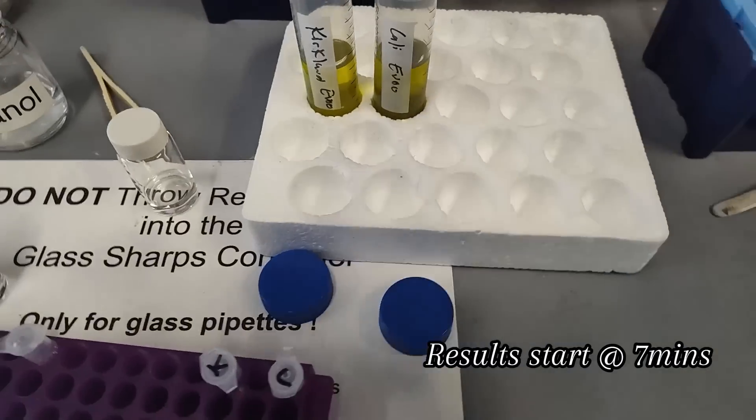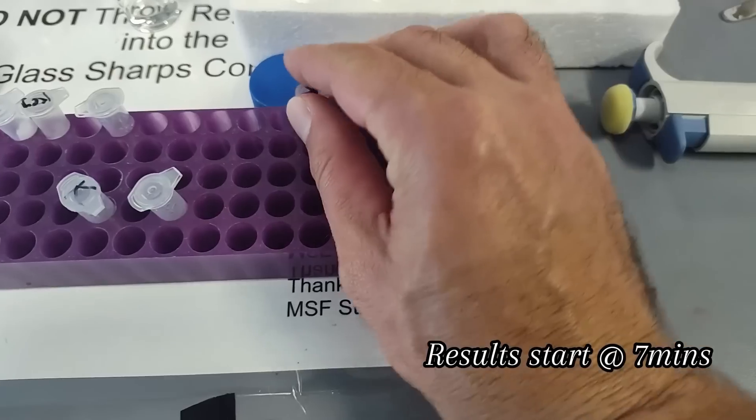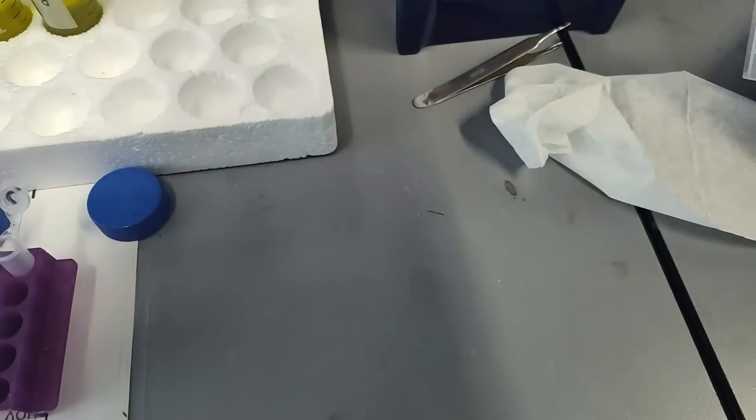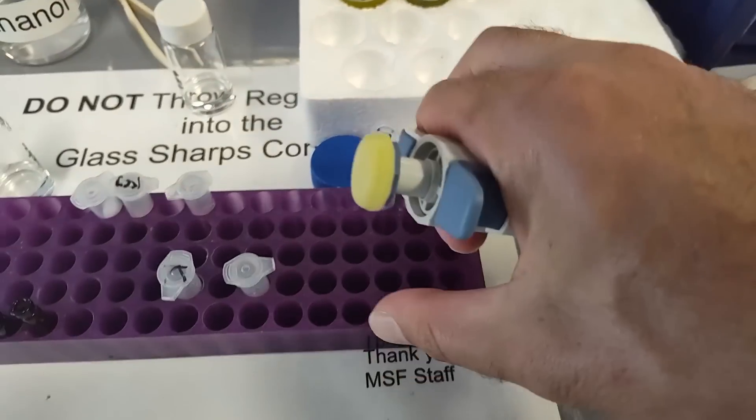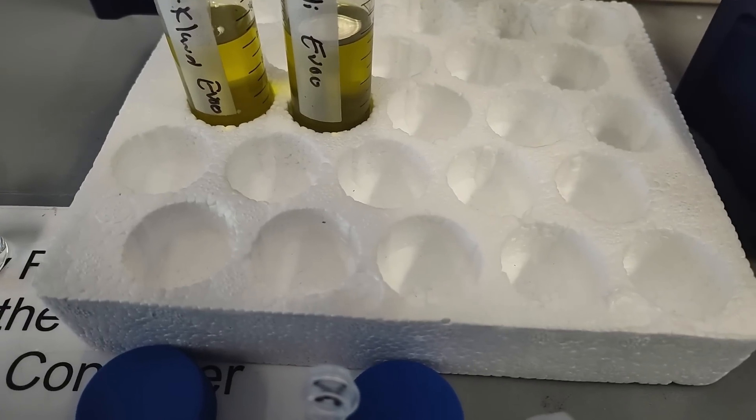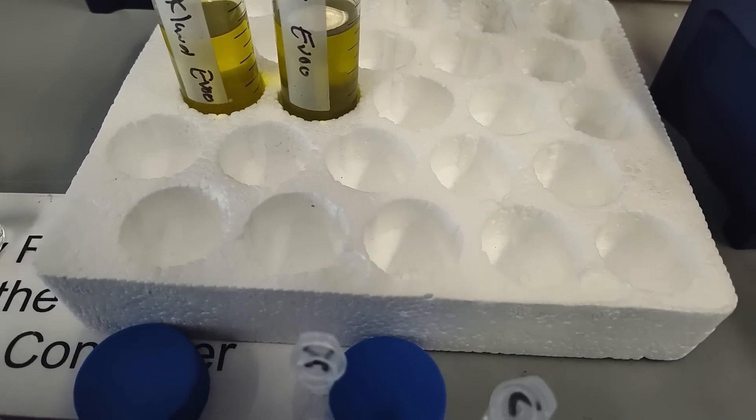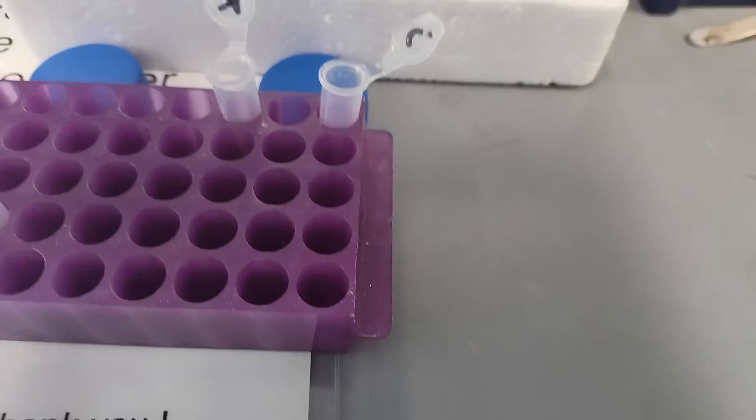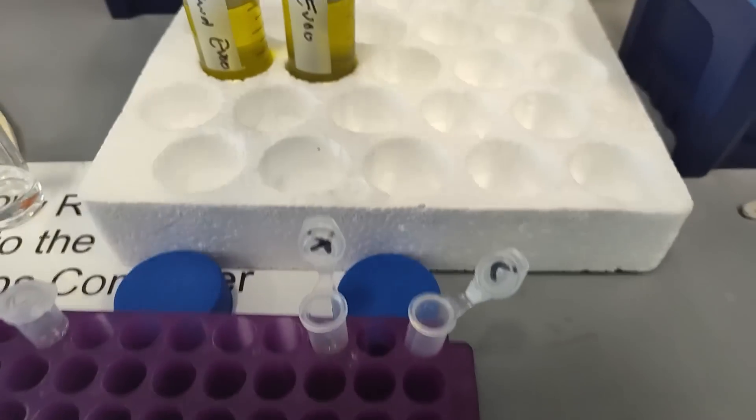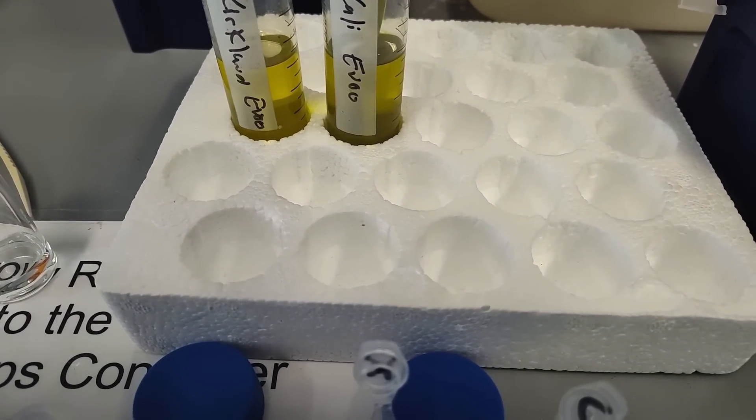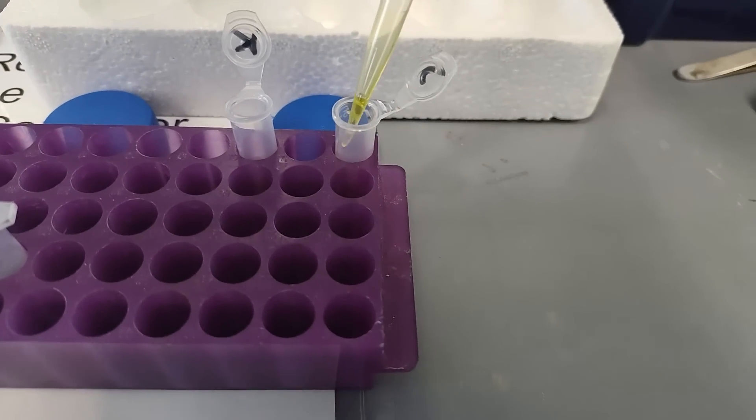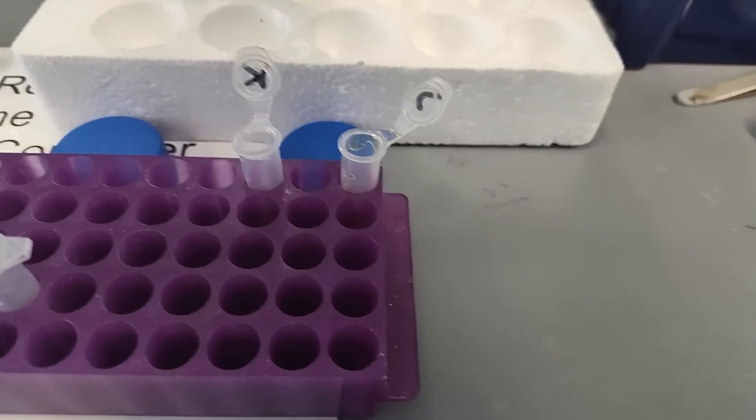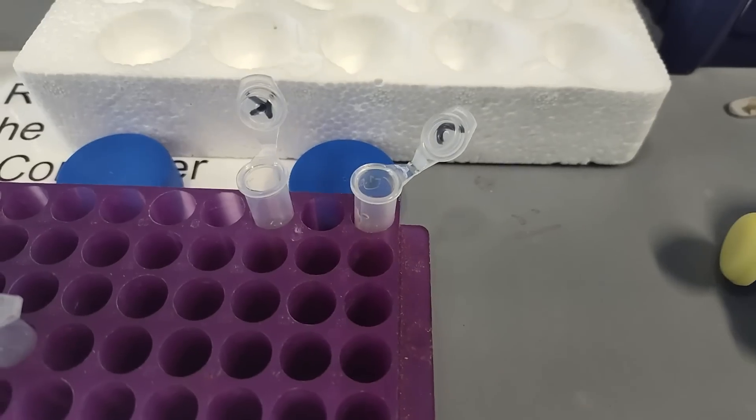Bright and early Monday morning here. We're going to transfer 500 microliters. You get a pipette real slow when you're pipetting oil. Of the Kirkland EVOO. They look very similar in color. They pipette similarly in texture. There we go. Now we've got to extract these.